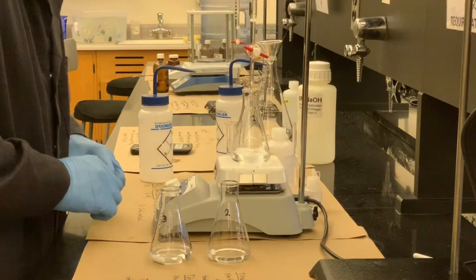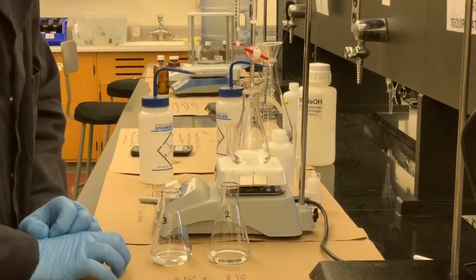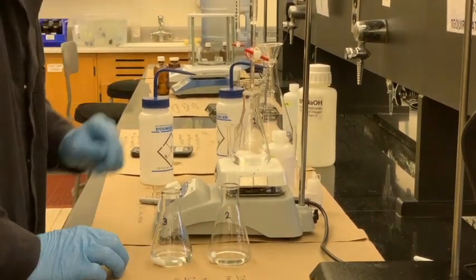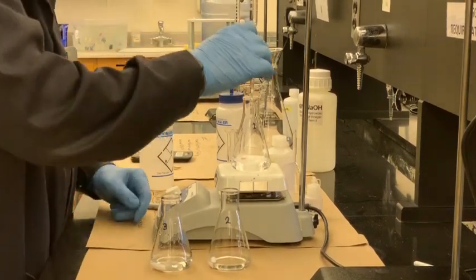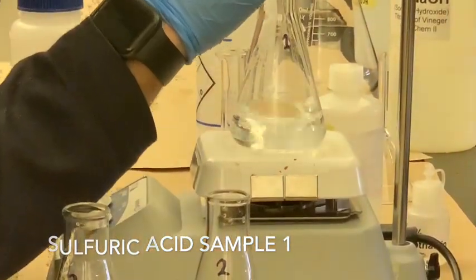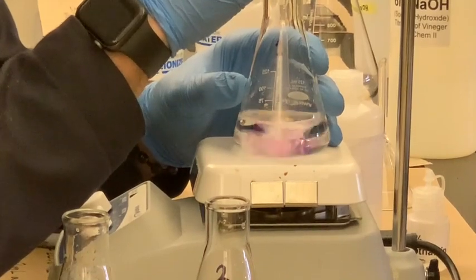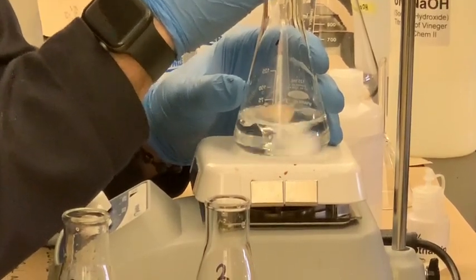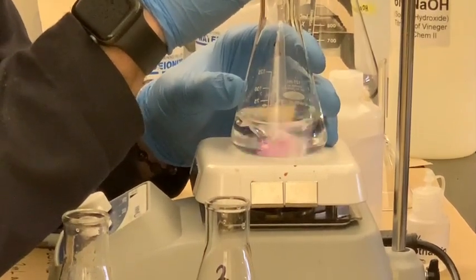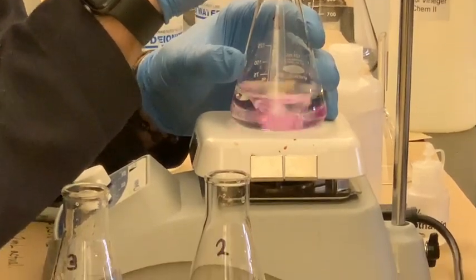Usually when you're doing an unknown that you haven't tested yet, you want to start with as much volume as possible and kind of take a walk on the wild side here. We still have about 40 milliliters left, so we should be fine. Let's get started. The real warning sign is when it starts to persist in color, which is getting closer. You want to move to the drops instead of allowing a stream. Now it's really starting to get persistent, so let's see if we can get it at exactly the right color.